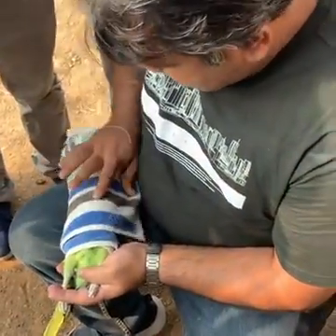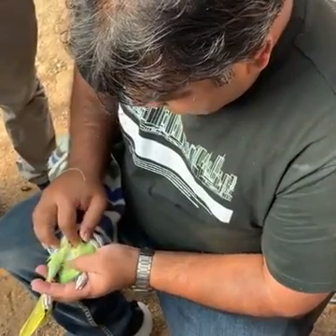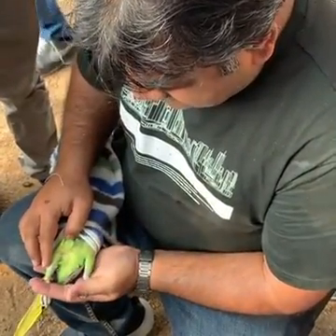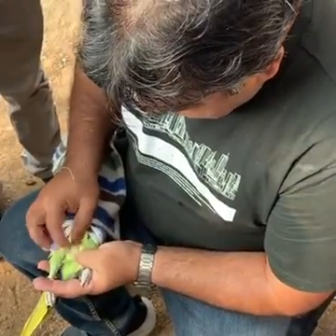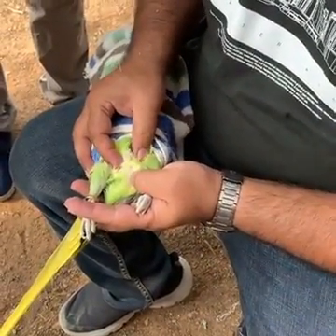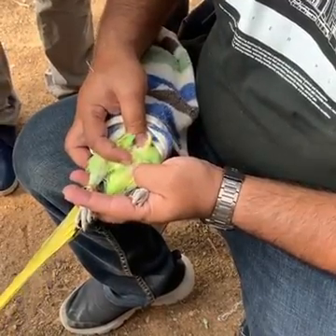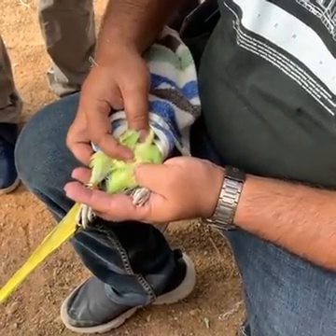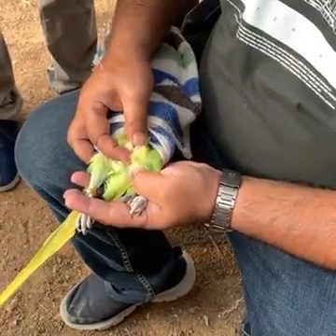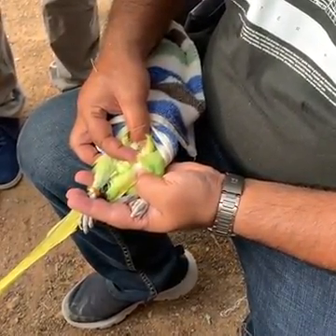He's calm enough, fully covered and relaxed — he will be breathing. Hold the legs like that easily and look for the place. With your two fingers, hold it like this: this finger and this finger have to be on the bottom, and the thumb has to be on the top. Then you just have to squeeze it slowly.